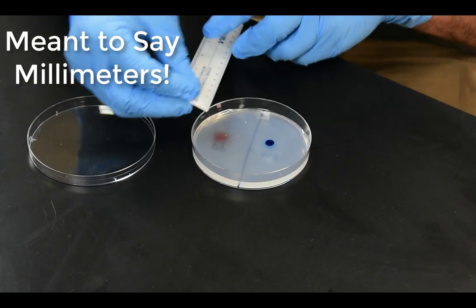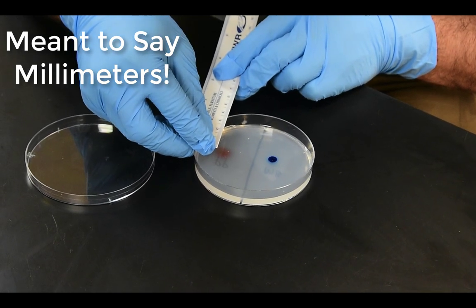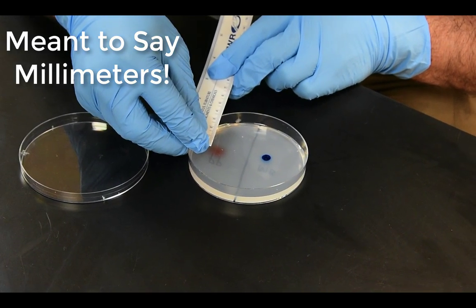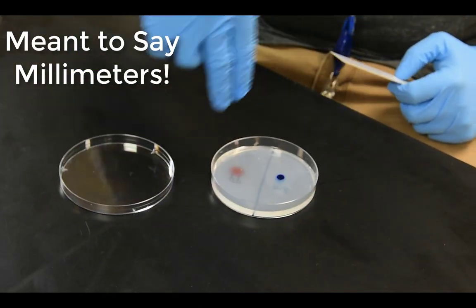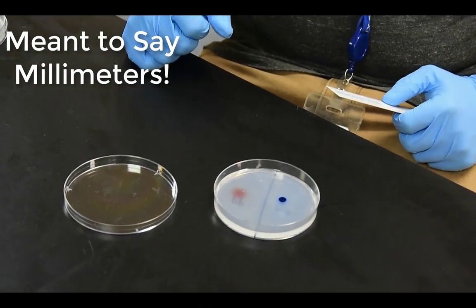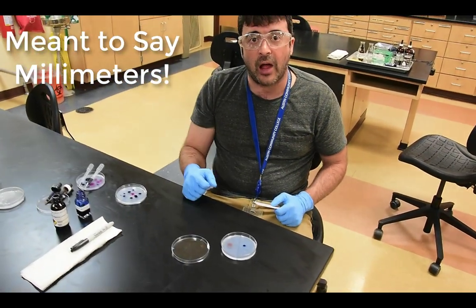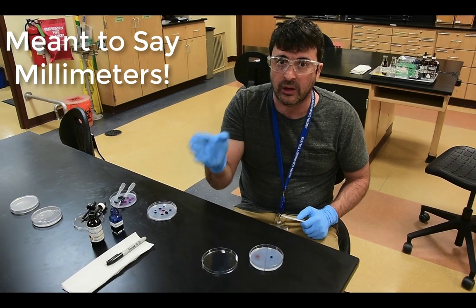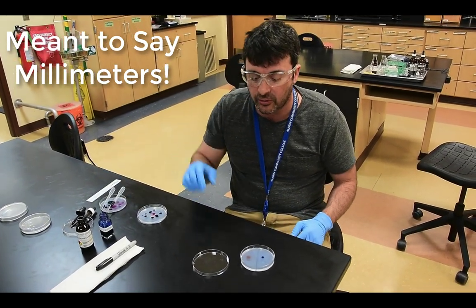So when we measure the potassium permanganate again, 14 millimeters. The diameter of that dot is around 14 millimeters if we go out to the very lightest of the halo. So there's your initial, there's your final. That's enough to answer the lab questions that you have over methylene blue and potassium permanganate. Keep diffusion and the factors that influence diffusion in mind.